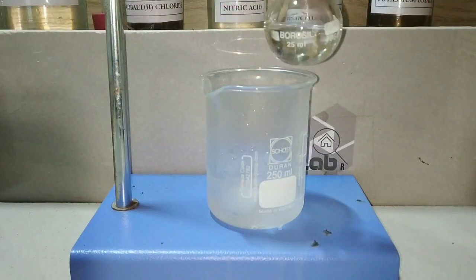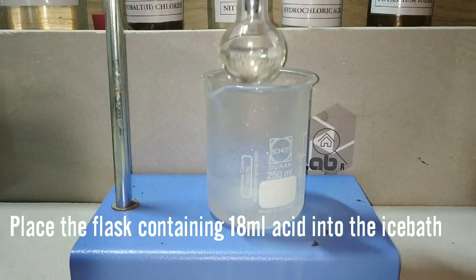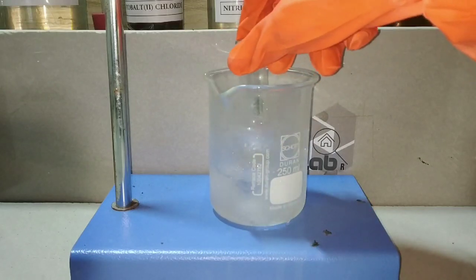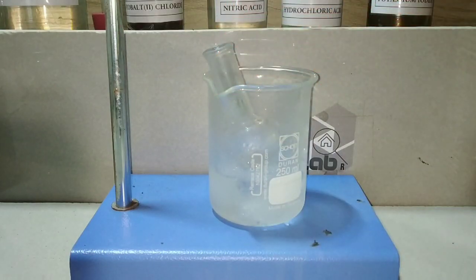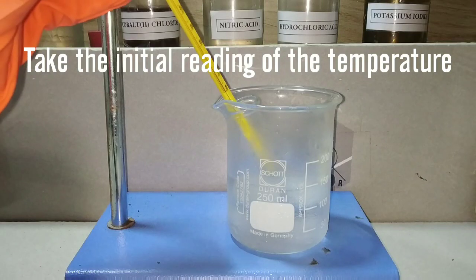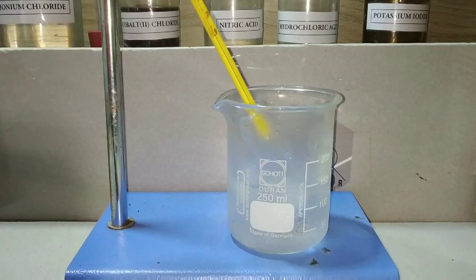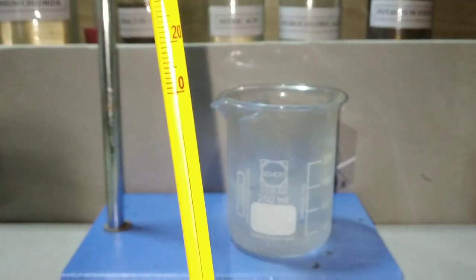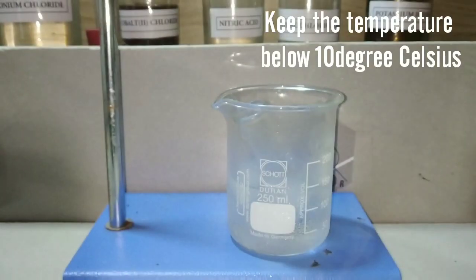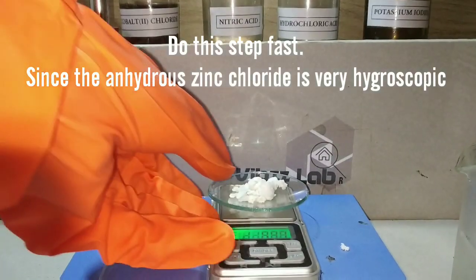We need to regulate the temperature so that the reaction can proceed in the right way. We place the flask containing 18 milliliters of concentrated hydrochloric acid in the ice bath and take the initial reading — it should be around 10 degrees Celsius. You can see the temperature is at the 10-degree point. Those fumes are hydrochloric acid; avoid inhaling those fumes.